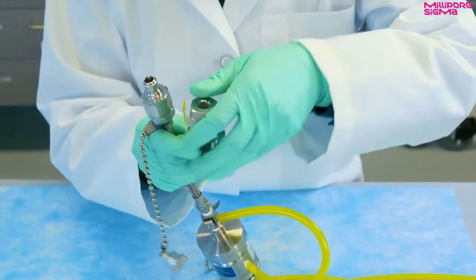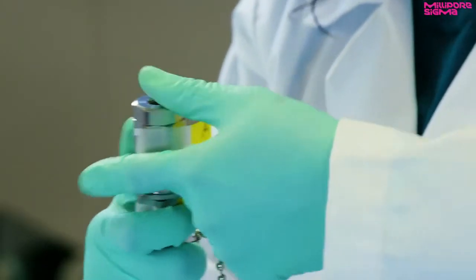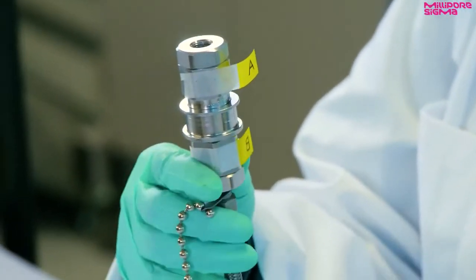To connect the sampler to the sampling port, insert the sampler nipple firmly into the quick release valve by retracting the valve collar and then release the collar when the nipple is sealed.